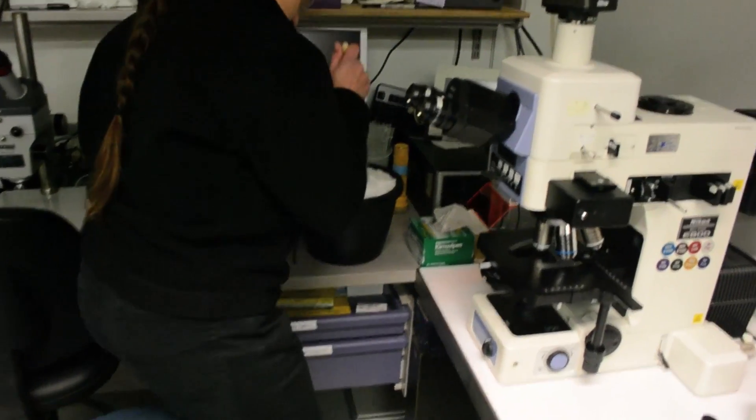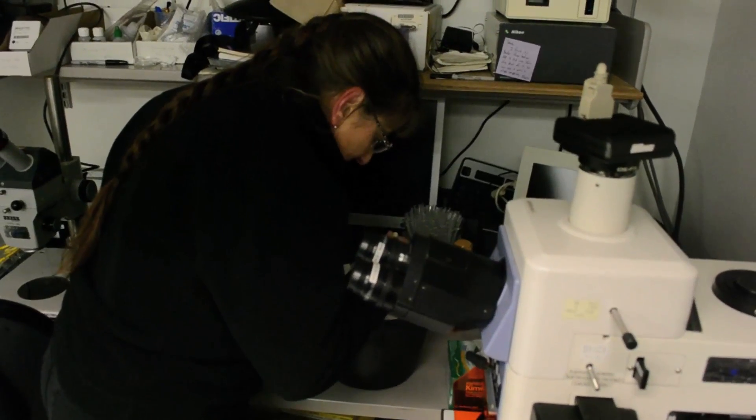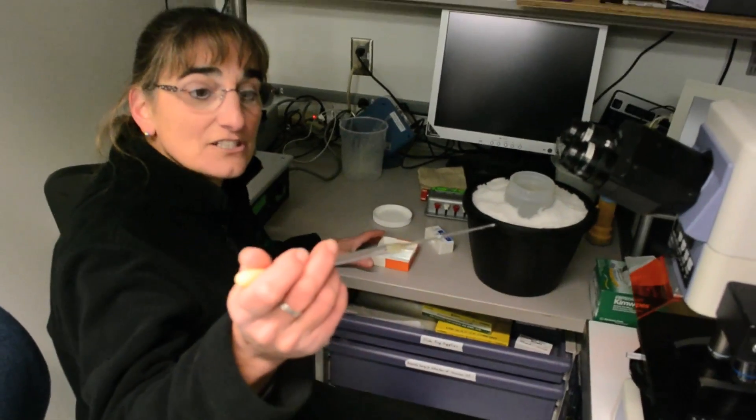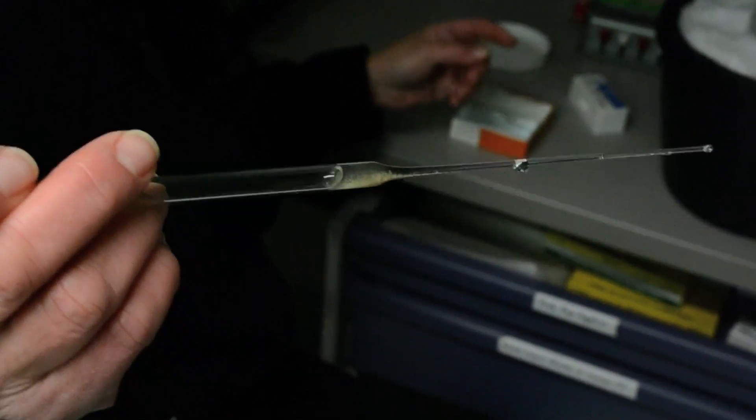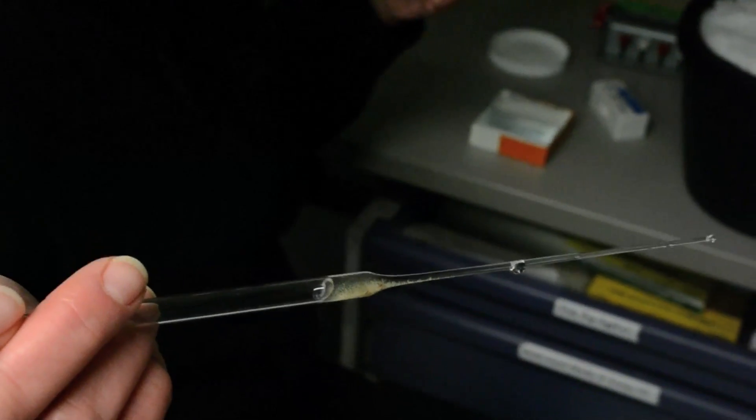I can actually go into this sample now and take some water. You can see there's actually color. Now you can see that there's actually something in the water, whereas if we just picked up a bottle of water, it would be very clear.